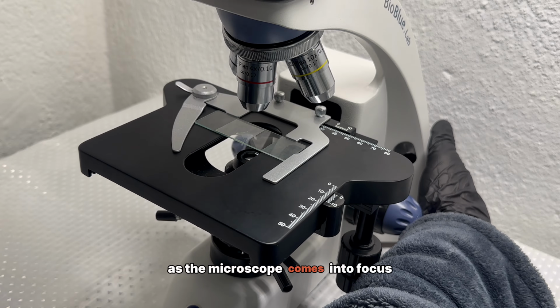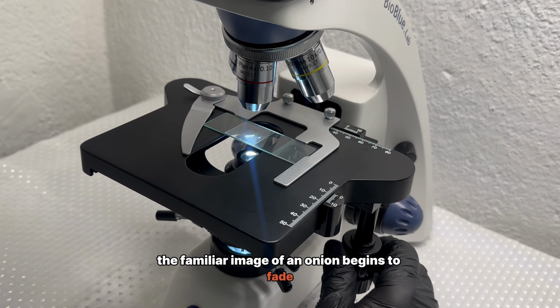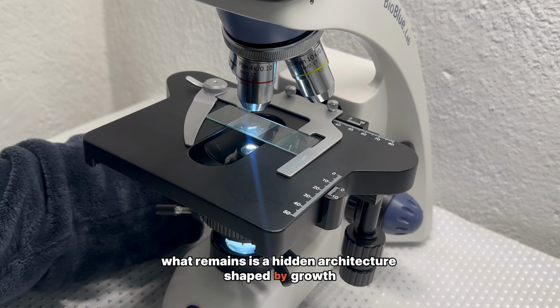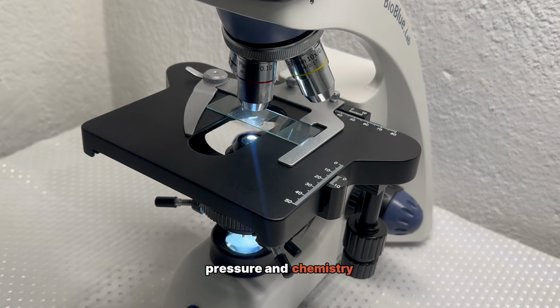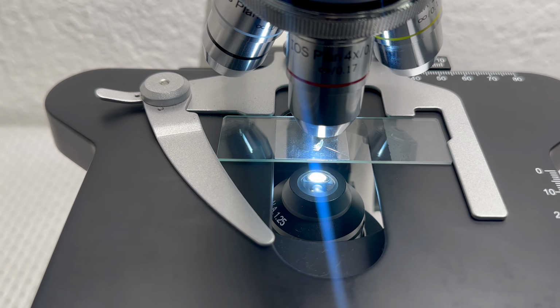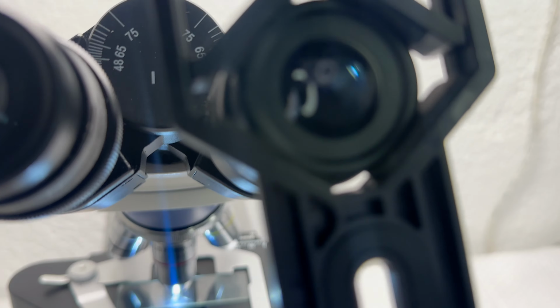As the microscope comes into focus, the familiar image of an onion begins to fade. What remains is a hidden architecture shaped by growth, pressure, and chemistry. This is where the ordinary stops being ordinary, and where the onion becomes something completely unexpected.